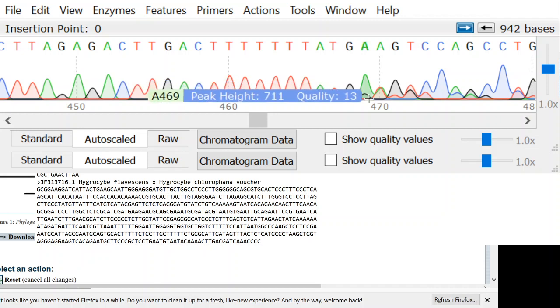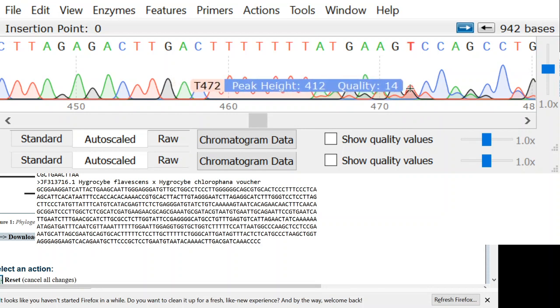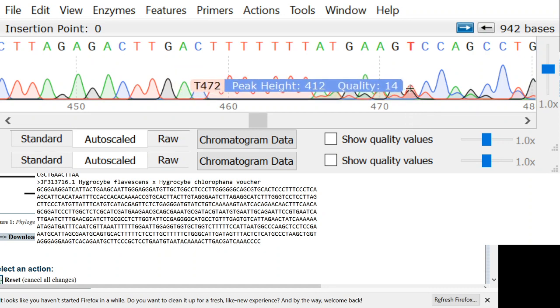So now we're starting to see problems because over here on the right, the peak occurs again in the next one. Here we have a black G, and that's good. But then we see the black G again over here, and we shouldn't see that. That's the enzyme slippage.